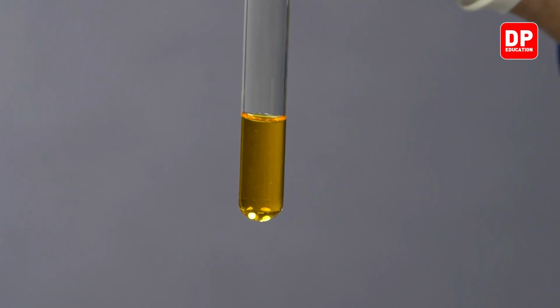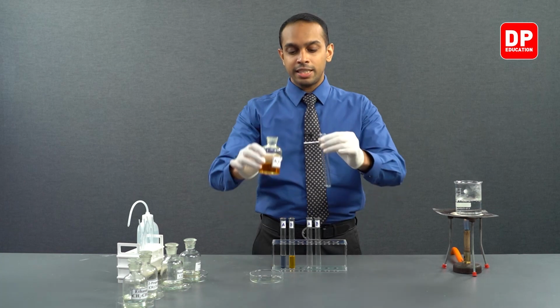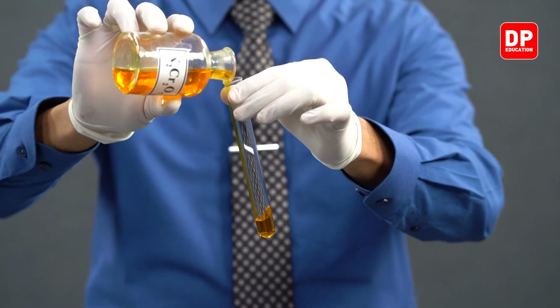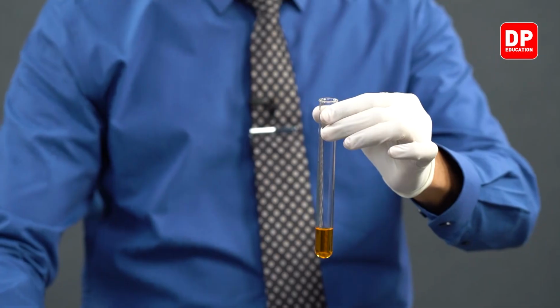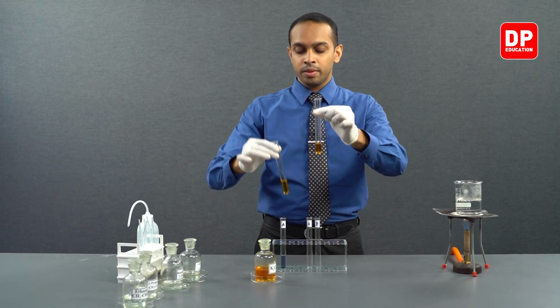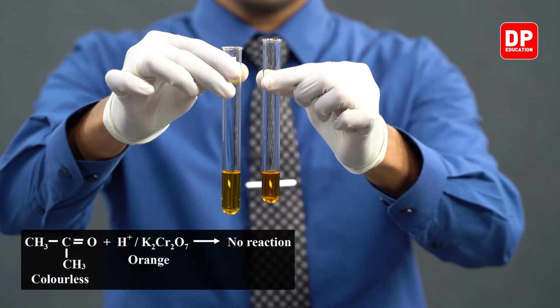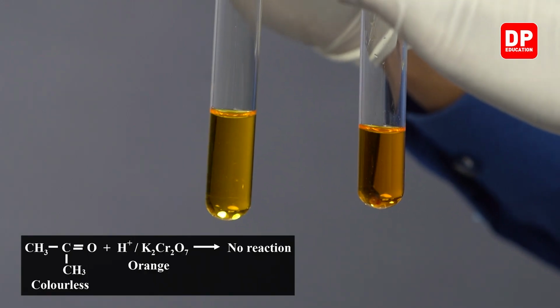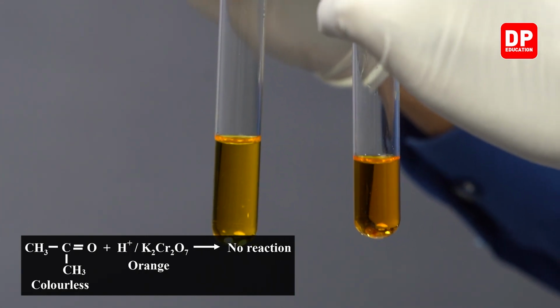To observe this very closely, to another test tube, let's take a little bit of acidified potassium dichromate. Now, we can compare the colors of acidified potassium dichromate along with acetone treated with acidified potassium dichromate. So the color has not changed. The only thing that you see here is a small dilution of the color.